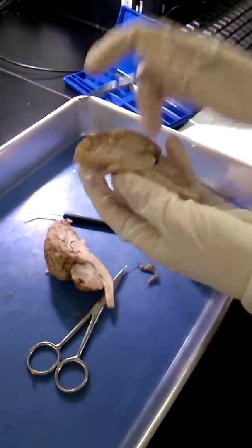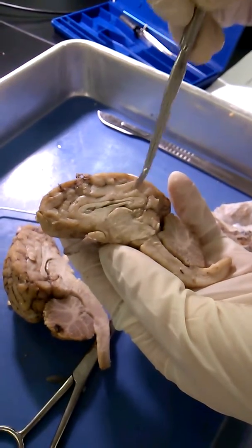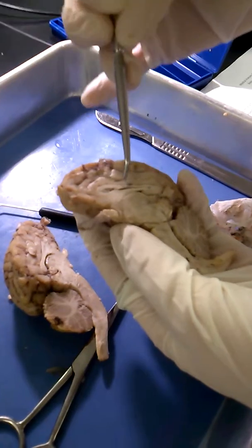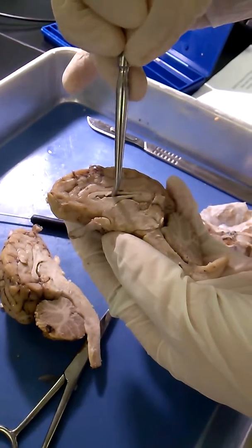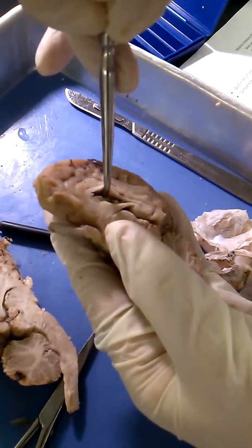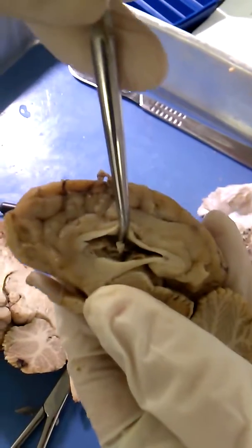Opening the brain, you can see the corpus callosum and the fornix, which is the bottom part here. In between there is a little membrane called the septum pellucidum, and the septum pellucidum covers a lateral ventricle, which is a chamber. Inside the lateral ventricle are little holes, which can't really be seen here. Those are called interventricular foramen. And also inside of the ventricles are choroid plexus, which are capillaries, which kind of can be seen there.